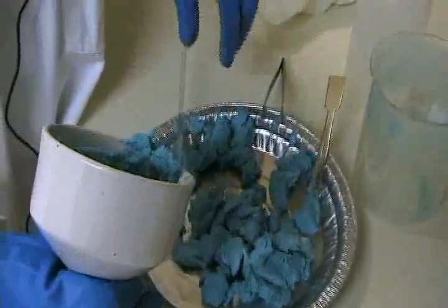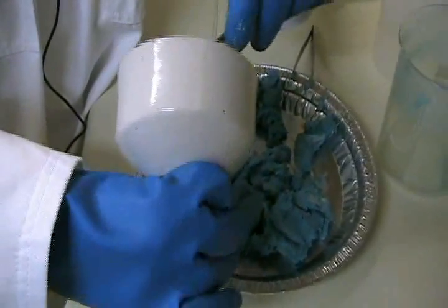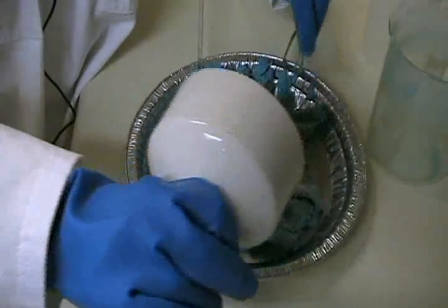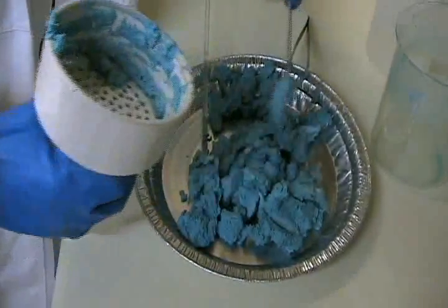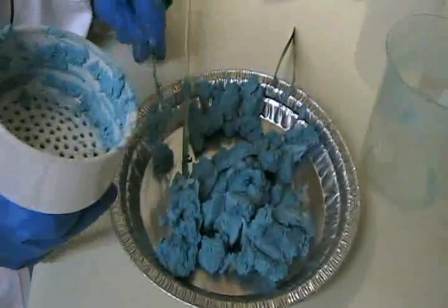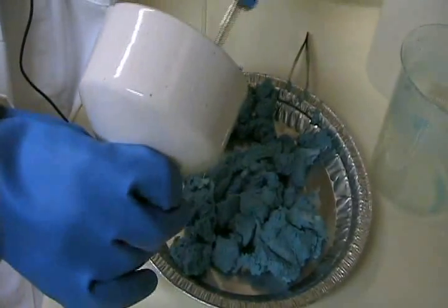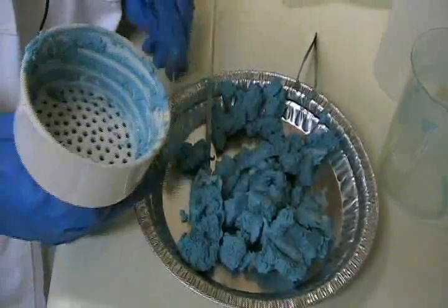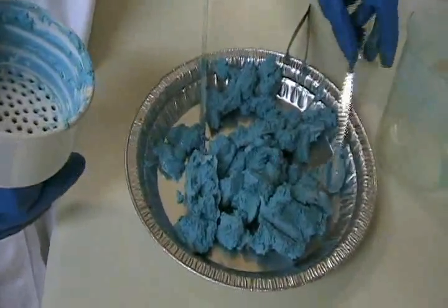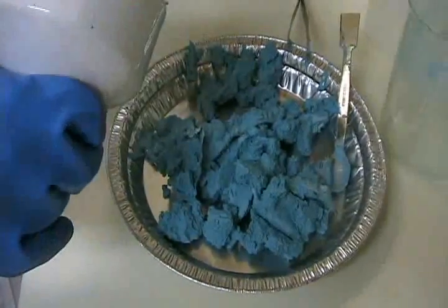Unfortunately there's a good bit of rupture there, but the crystals, once they dry, will be a nice powder and should be very easy to handle. Right now they're kind of gummy — you can see they're quite sticky. But it looks like we have an excellent yield here of copper carbonate. You can see how they might be used as a pigment because they do have a very thick paint-like consistency at this point.